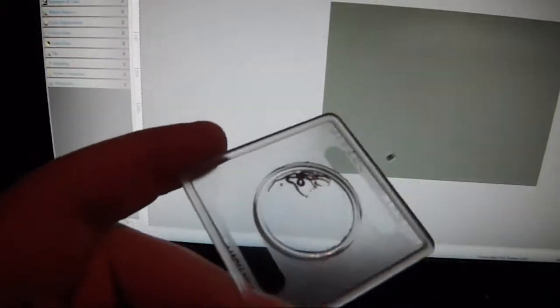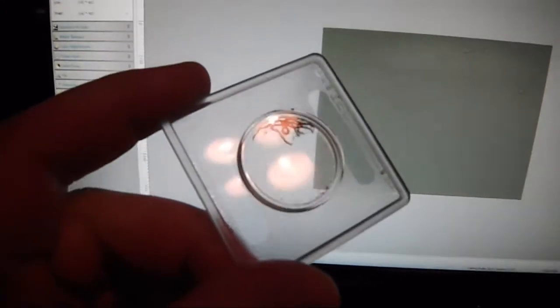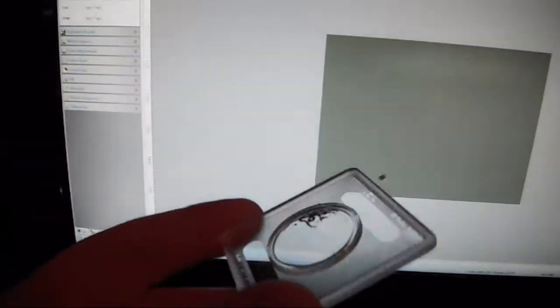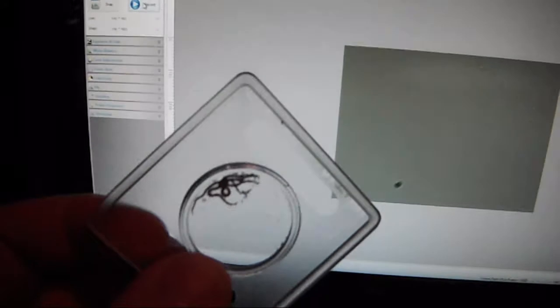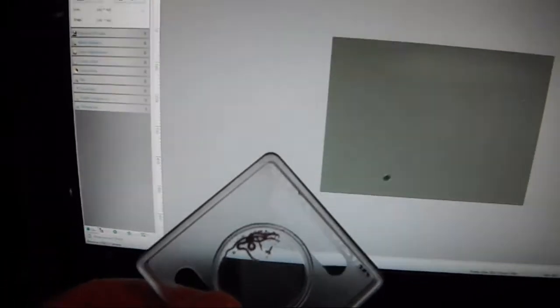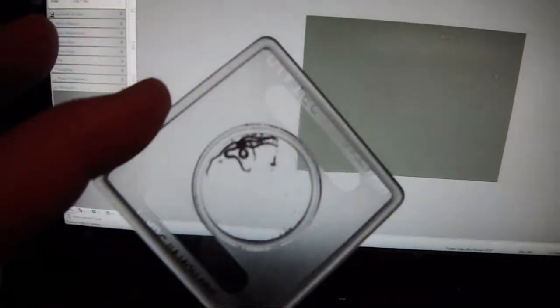Just in case you wondered, these are special slides that I have and they're just discs with a lid. This mini brittle is actually going to be fine and we'll let him out. He's in water and I'll let him out and he'll live the rest of his life all happy. I don't like to kill things for my little microscope hobbies.